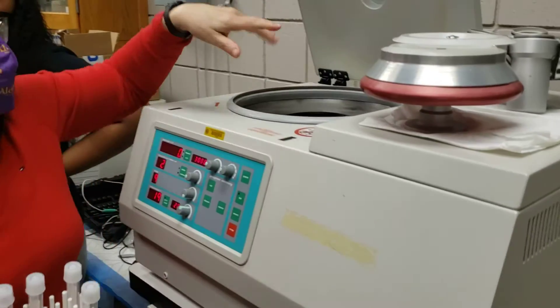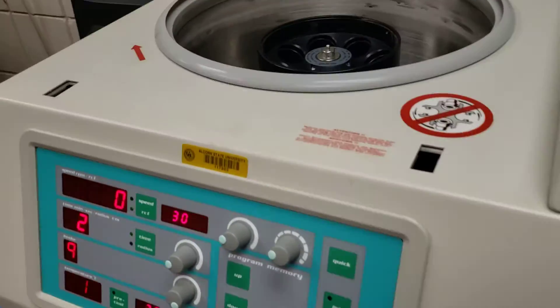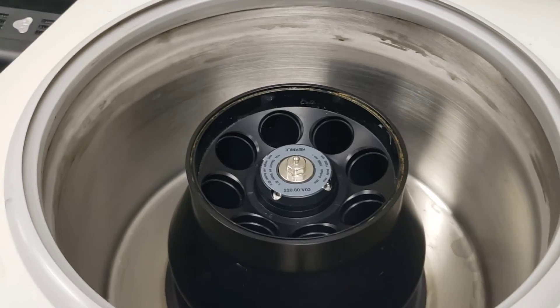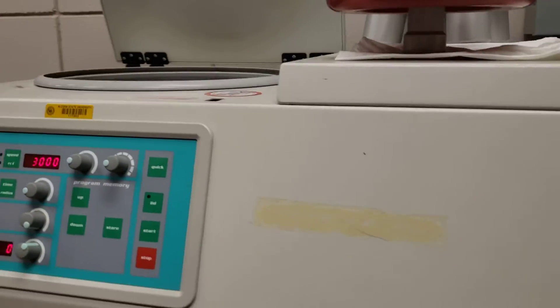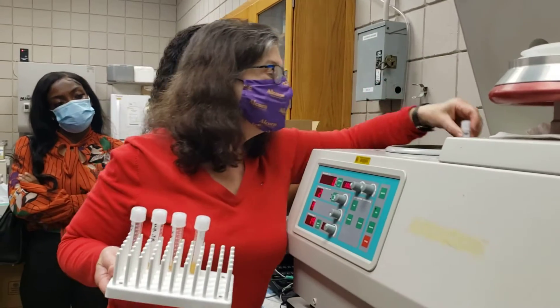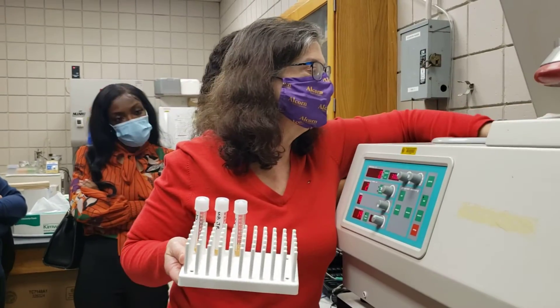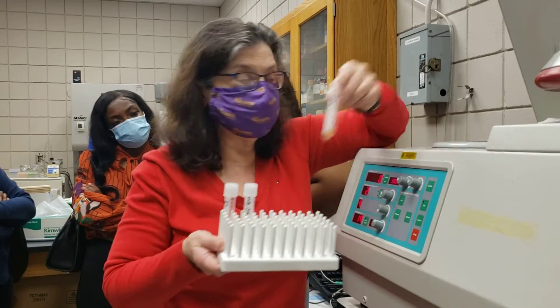If you look inside — I see you have a picture. They are really big, but this will be okay. I'm going to put the tubes in such a way that they face each other. You can take a picture of it. Otherwise the centrifuge will be unbalanced.